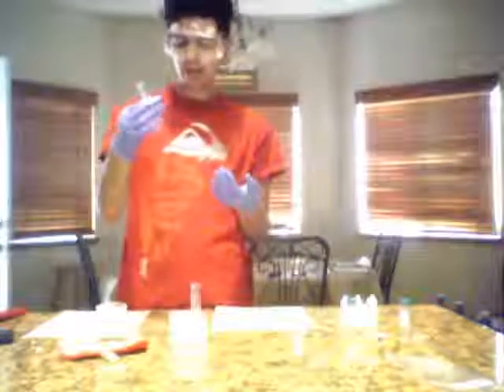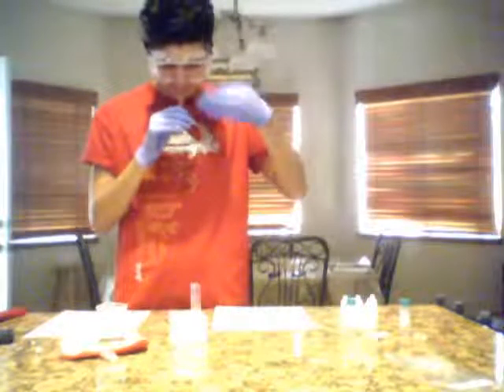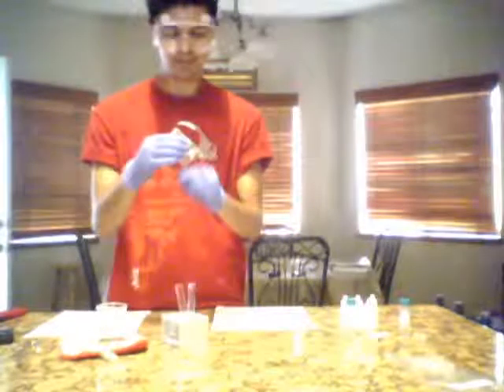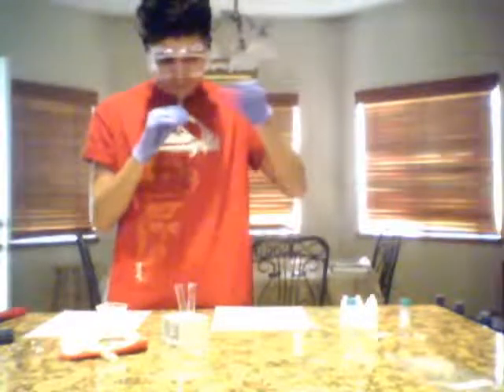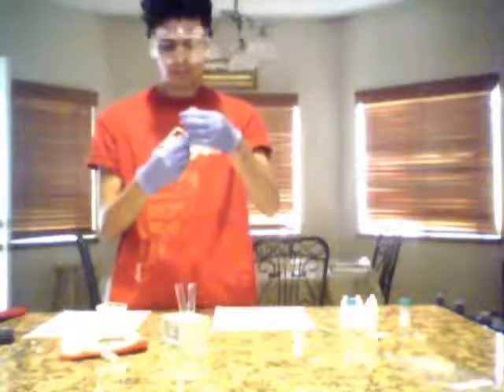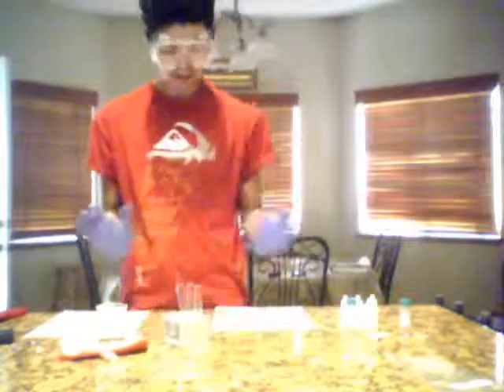This one to me is very sweet. Almost to me it resembles kind of like a banana smell. Yeah, I would say it smells like a banana to me. Number 1 is kind of hard to detect. But if I had to say anything, it almost has like a vinegary smell to me.